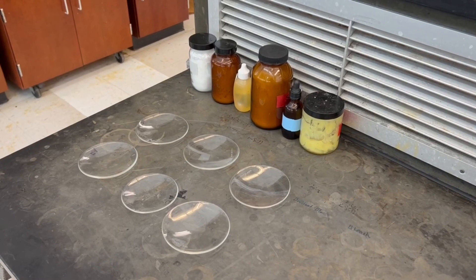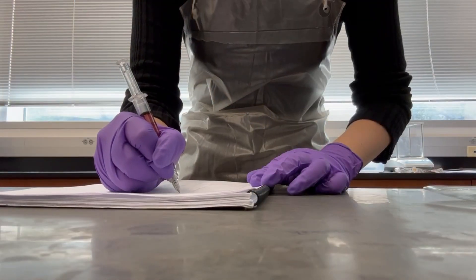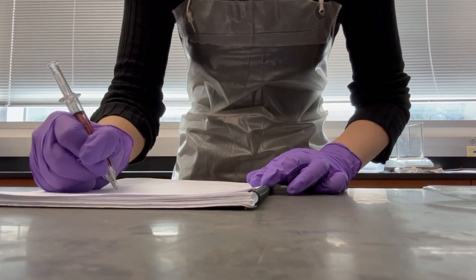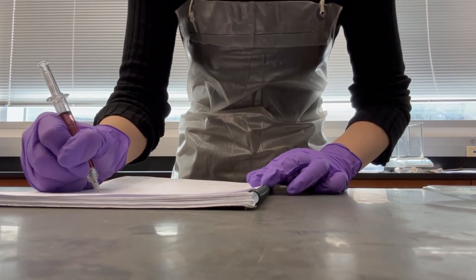To start with Part A, your TA will prepare six lipid samples in the lab. You must observe the lipids and fatty acids. Record the appearance and odor of each lipid on your datasheet.